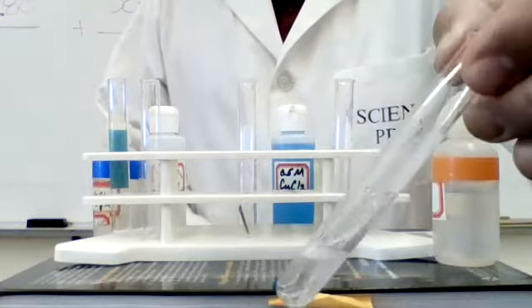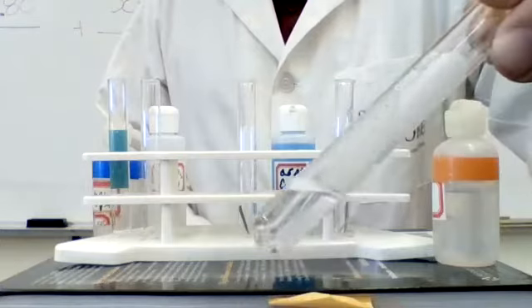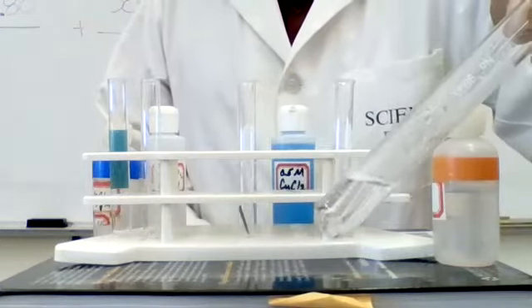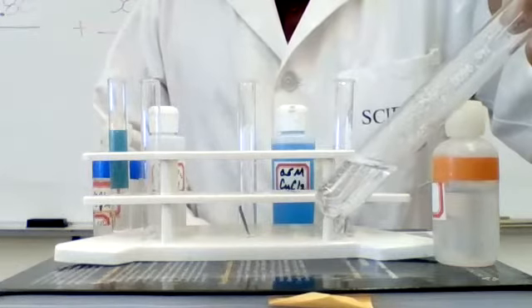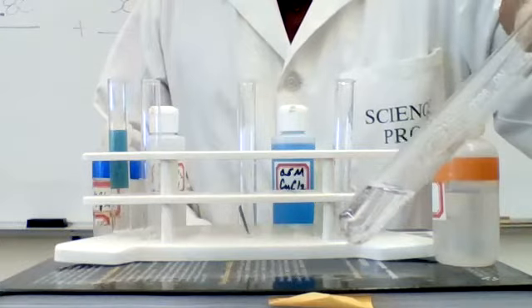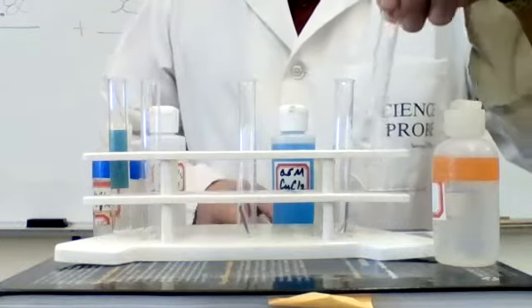In this case, why is magnesium reacting and now the reaction is over? Is because the magnesium is higher up than hydrogen. It is able to displace or react with the chlorine and release the hydrogen gas.